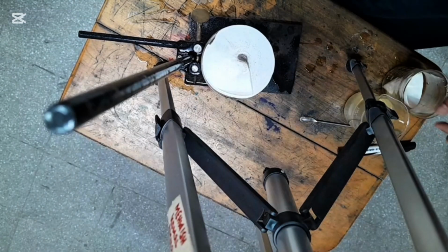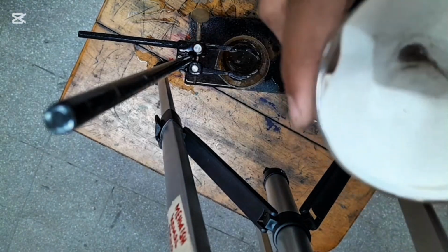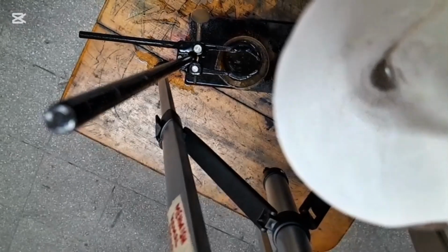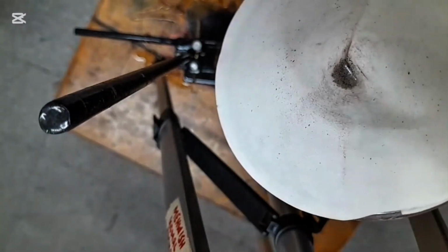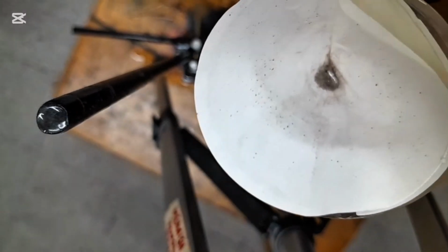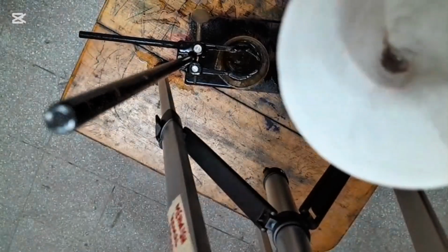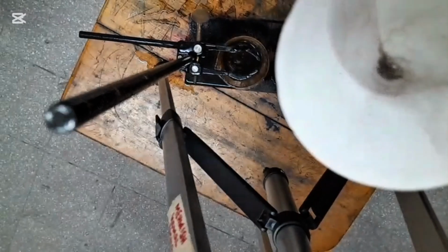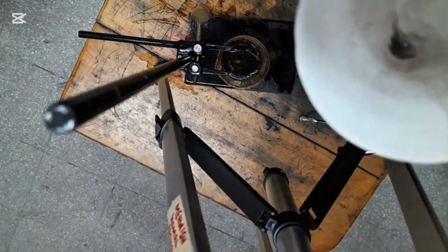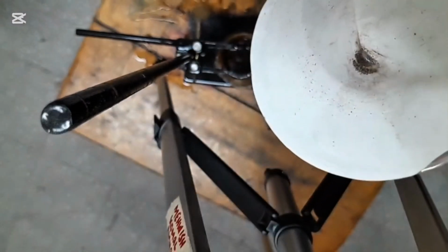So the filtration process has been completed. You can see that there is something left as a residue on the filter paper. You can see it clearly. Have a look. These are the suspension particles which are not getting mixed with the water. When I mix the sand particles with the water, after some time they settle down in the beaker, and when I filter them, they are visible on the filter paper, left as a residue. You can see it clearly.